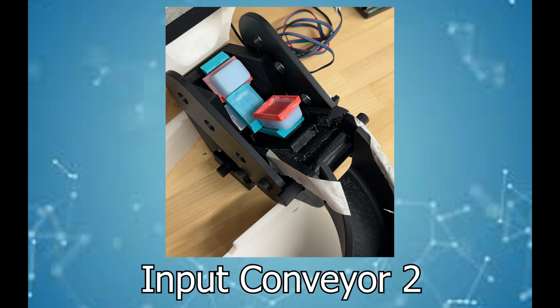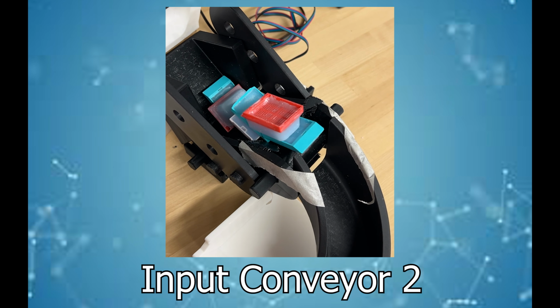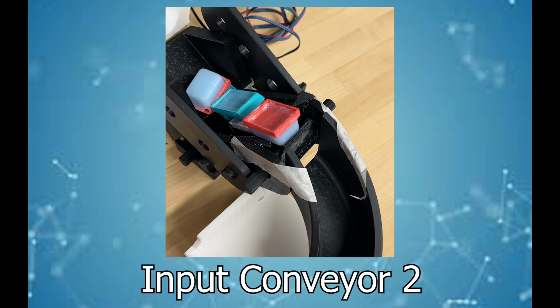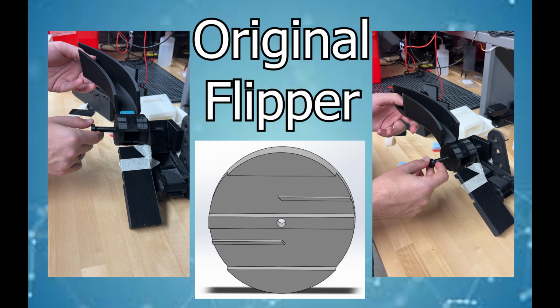This next conveyor setup reflected those changes as well as included our preliminary chute design to assist in the transition of getting tissue blocks from the conveyor to our flipper. We approached a similar fashion with the flipper and rotator by 3D printing our preliminary design and testing it with the tissue blocks.